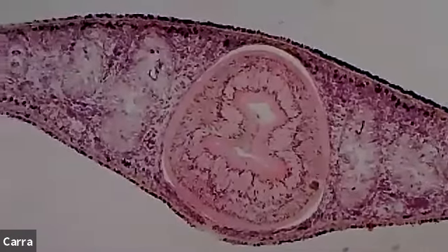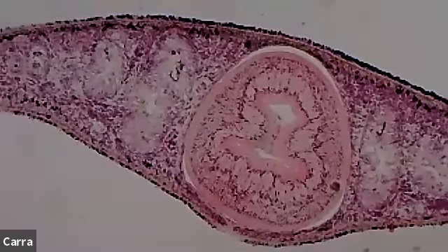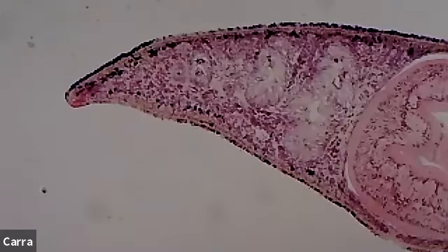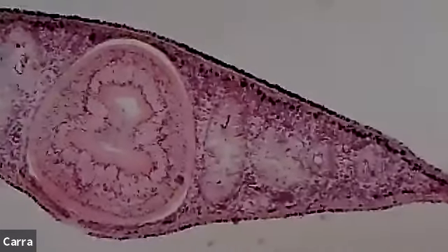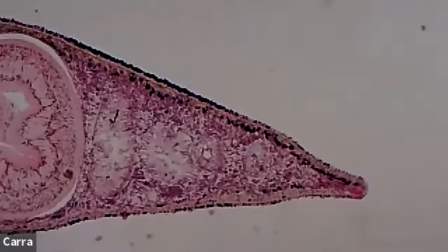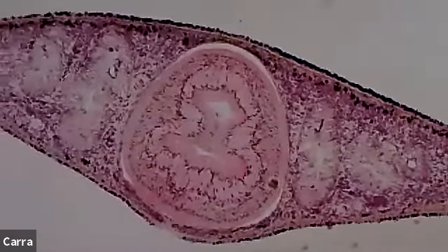Okay, so here's a planarian. This is a flatworm, and we cut it into cross sections. And so what you're seeing is we're going to go to one side. So here's the little tip. That would be like his left side or something. And then let's go to the other side, the tip, that's the right side. So they're a little bit flatter on the sides than they are right there in the midsection.